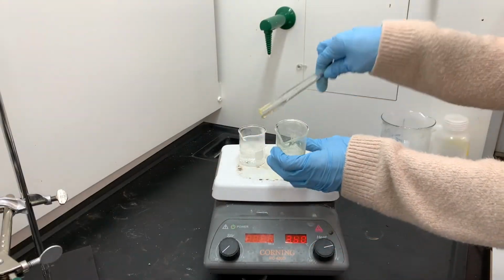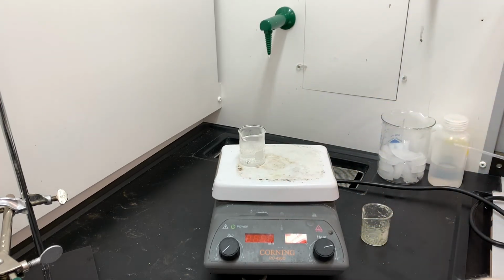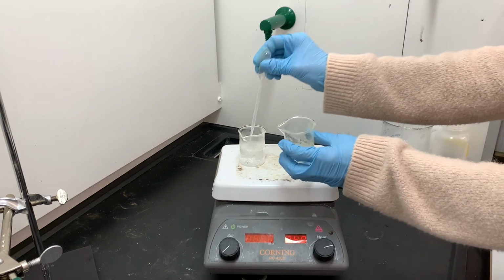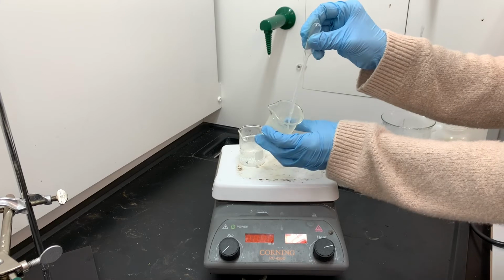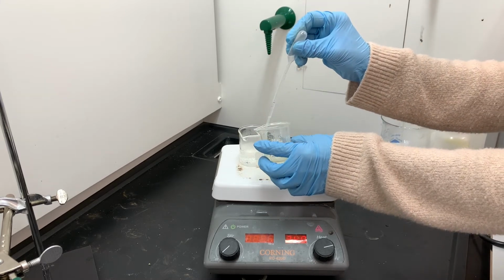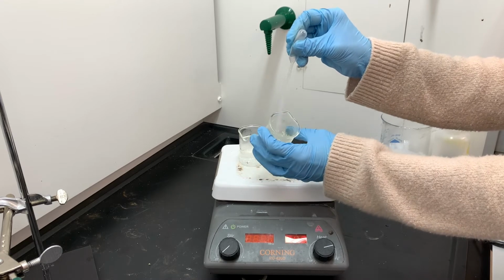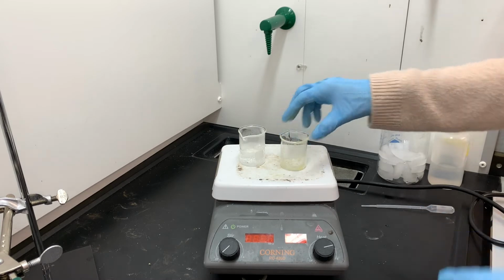So now it's time to do the recrystallization. Remember, the product is just stuck on the inside of our beaker, a glass stirring rod, and also a metal spatula. I'm recrystallizing from boiling water, and I'm starting by just putting the boiling water directly inside that beaker that's got the product stuck to the sides. And I'm using this pipette to rinse down the sides of the beaker to help dissolve the product that's stuck on the sides of the beaker.